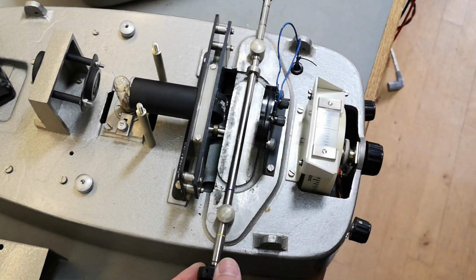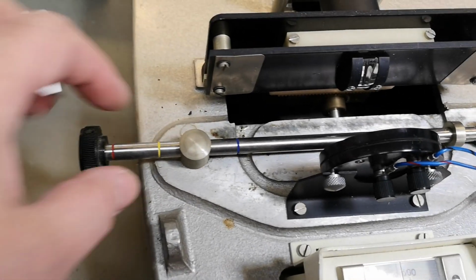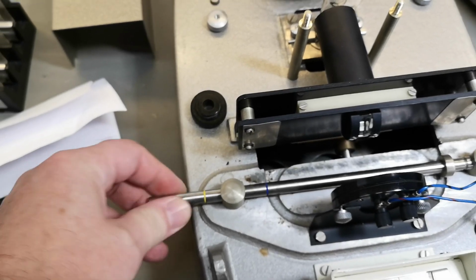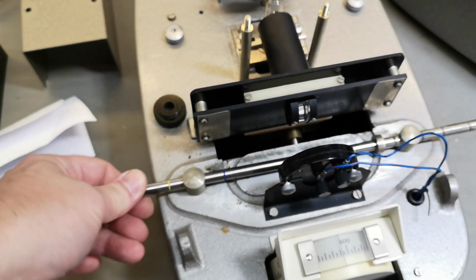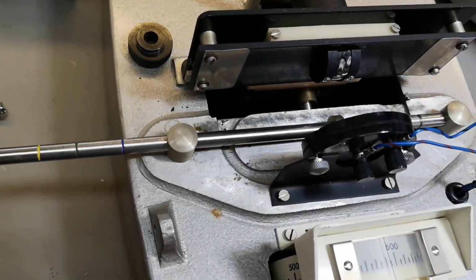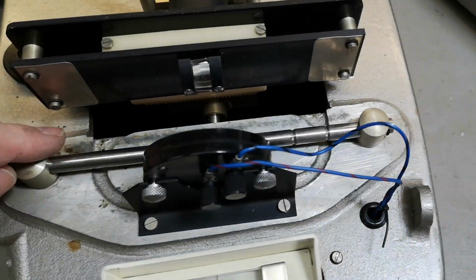What is inside the base? Oh, here we got different colors for the different test samples. Now it's easier to see. And if I pull this, it's just gonna fall off. I think it's because this one is kind of stuck. Yeah, it's definitely completely stuck. So how do I fix that? Whew, that was tough. Okay, this thing can move, but you need like 100 kilos to move it. Oh no! So it's just completely stuck in here. In both of these, I guess.